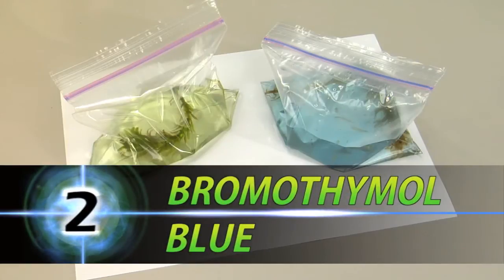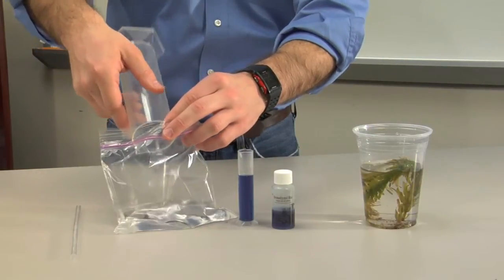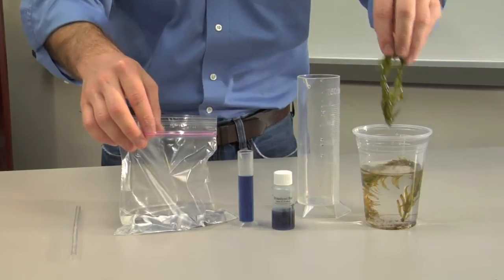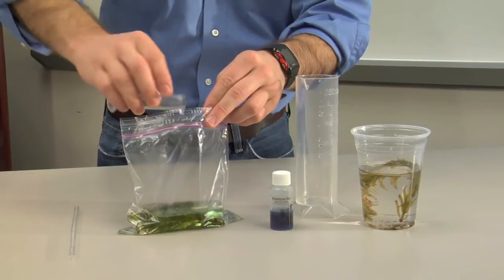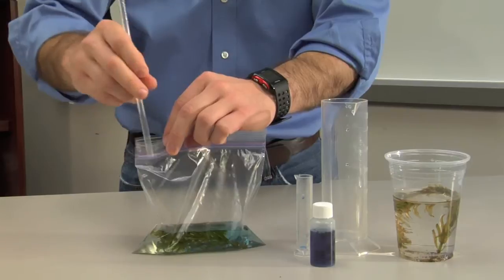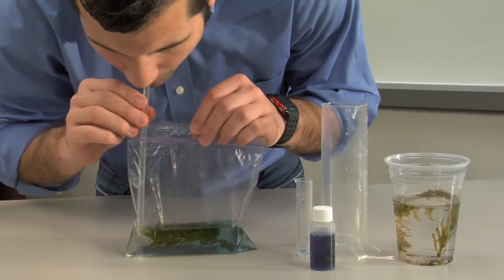Photosynthesis using Bromothymol Blue. In a small plastic baggie, pour 150 milliliters of water and submerge one Elodea branch. Add 10 milliliters of Bromothymol Blue. Close the bag, leaving just enough room for a straw. Blow through the straw for five seconds. Note how the color of the water changes from blue to green.